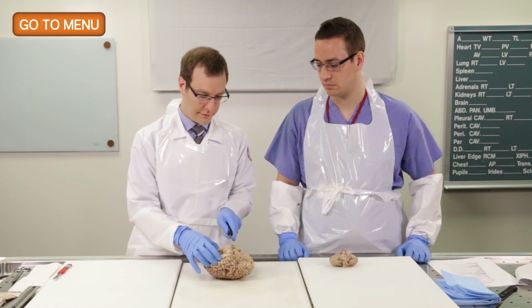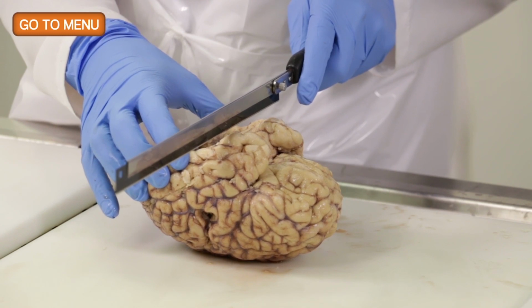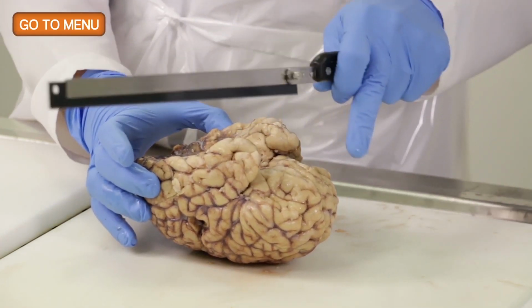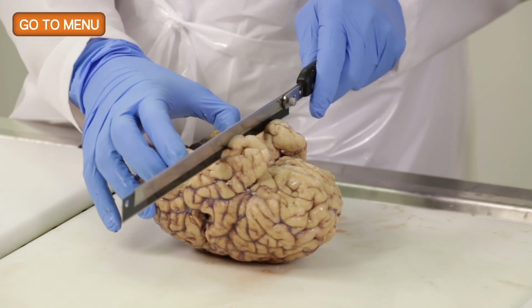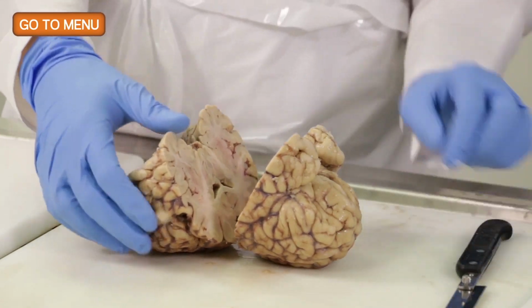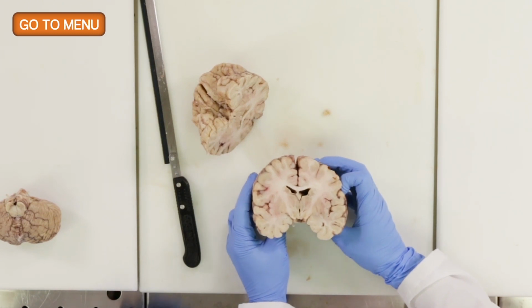That way you don't have too many artifactual lines on the surface of the coronal section. So I'll make the first cut through, and you want to try to make your cut, obviously, perpendicular as possible to the axis of the brain so that you'll have a nice symmetric section. So we make our first cut like this, and you can see this is reasonably symmetric.